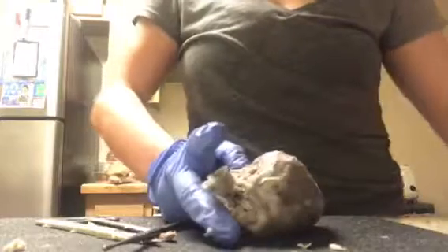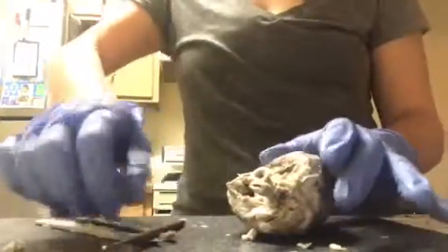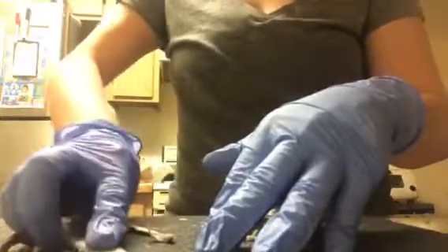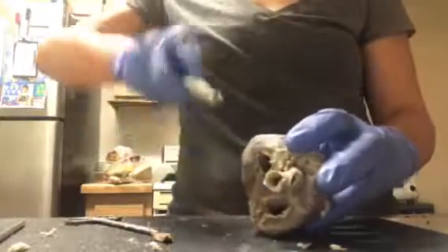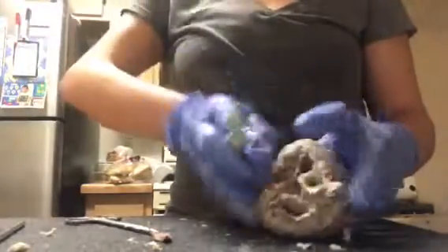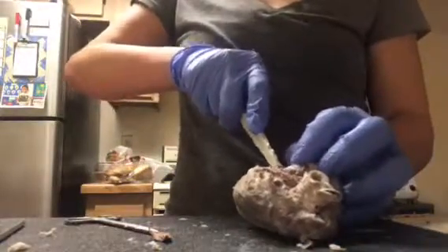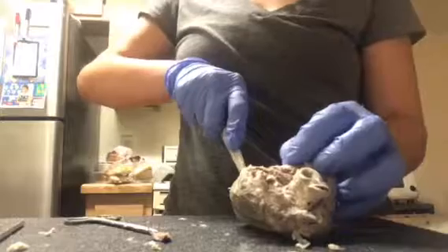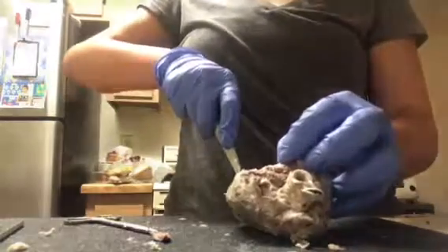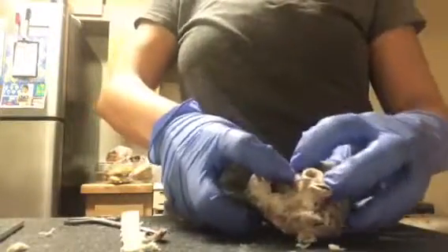So now we're going to cut the heart open to expose the atrium. I'm going to take my scalpel and get the skin off of that. I'm going to turn it to the side, and first let me cut it downwards. I'm going to use my scalpel very carefully. We're going to cut straight down all the way to the interventricular artery, and we will cut that right open.